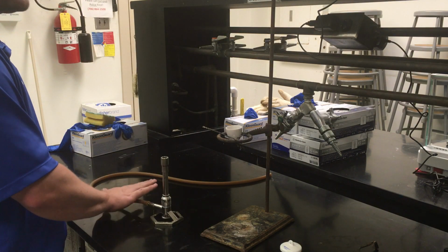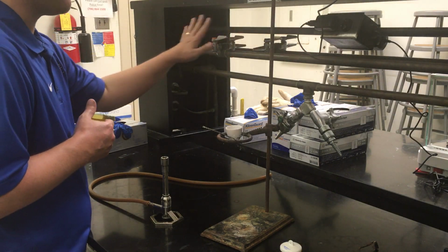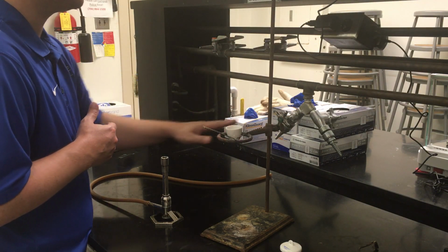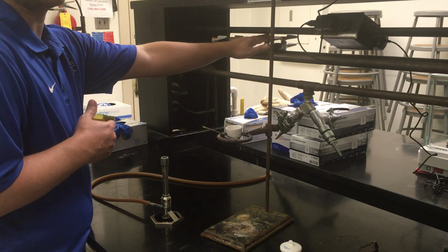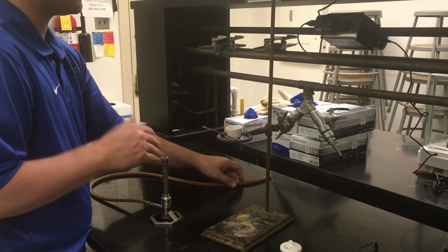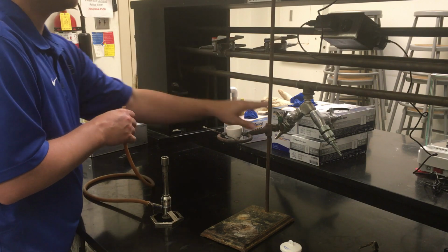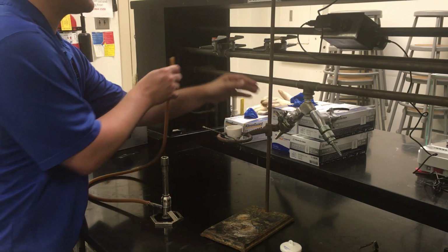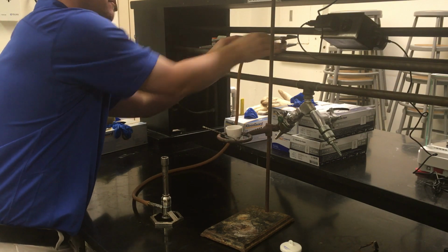So when using your Bunsen burner, the first thing you want to make sure of is that you get it connected to the right valve. We have three different possible valves you can connect to. Make sure you connect it to the one that has the blue cap. That's the one that's going to have gas. That's the only thing that's actually going to get a flame out of your Bunsen burner. Orange is air. Green is water, which will lead to a very wet surprise if you happen to get that one. So make sure it goes onto the blue cap.